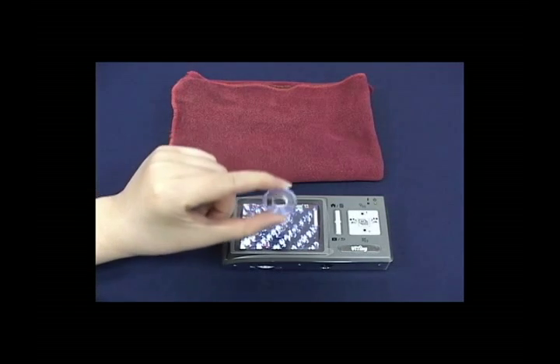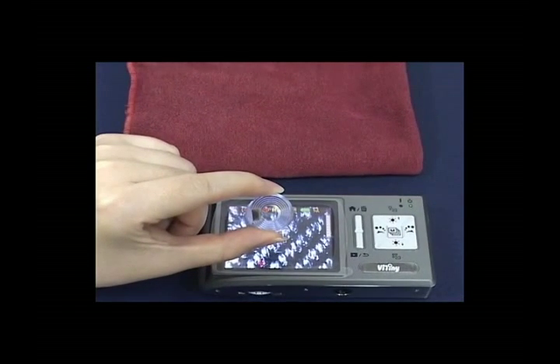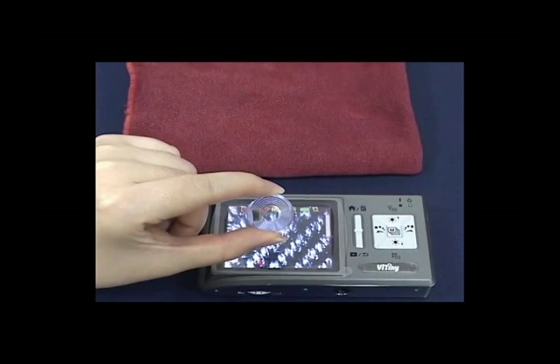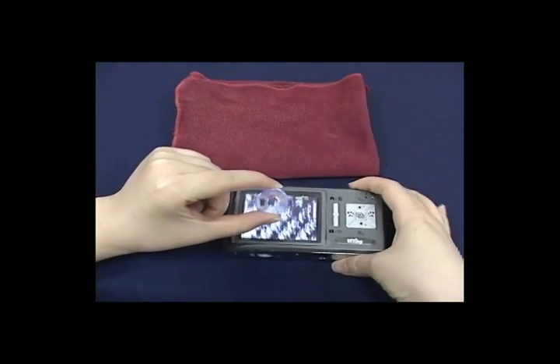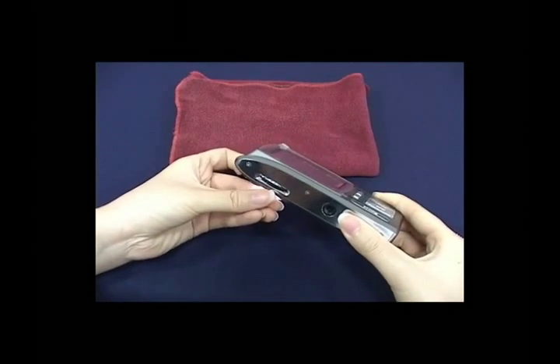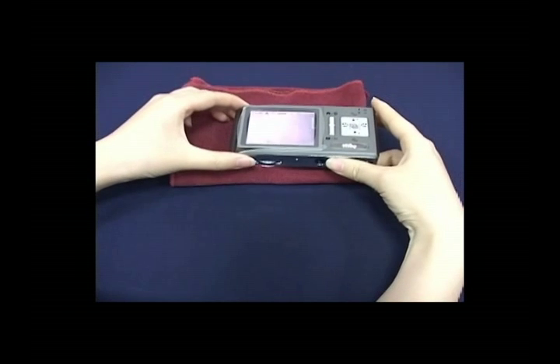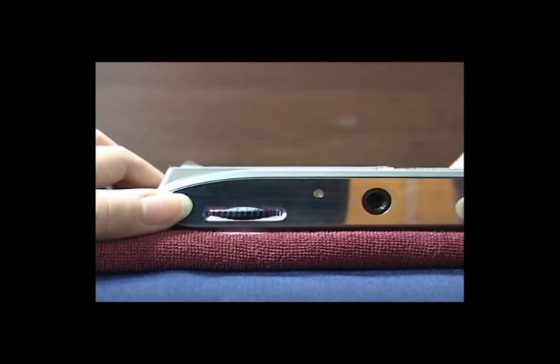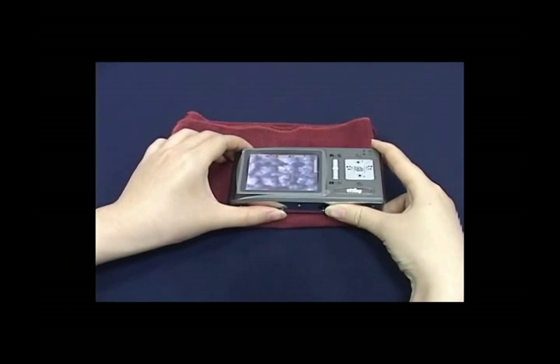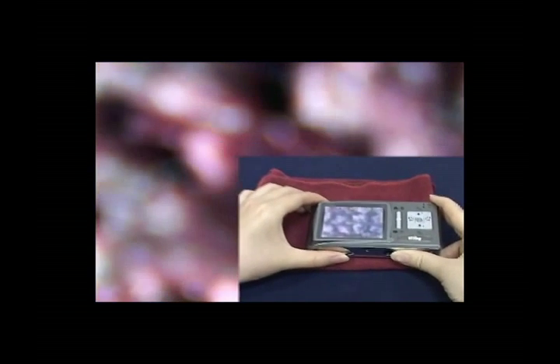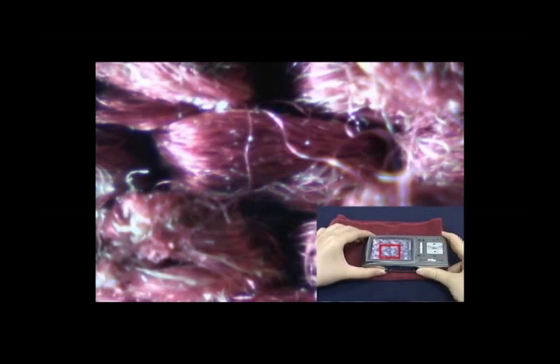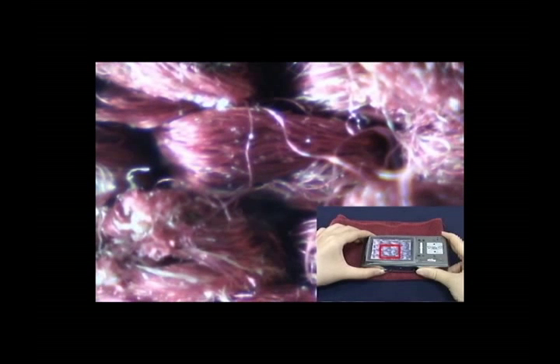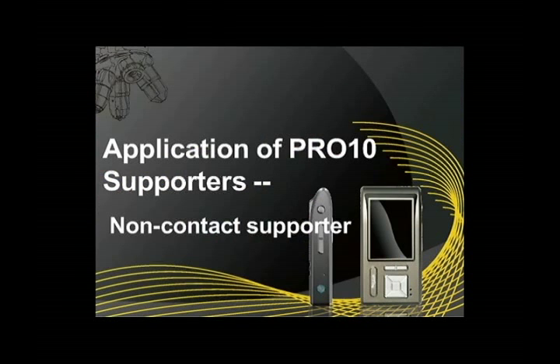Place the shallow contact cap onto the machine. Shallow contact cap has magnifying lens which can attach to the screen. Shallow contact cap is used to observe soft materials like cloth, wool, paper, hair, skin, etc. Adjust focus and lighting to start observation.